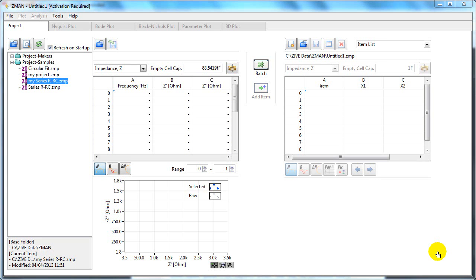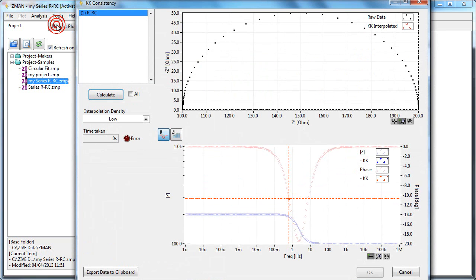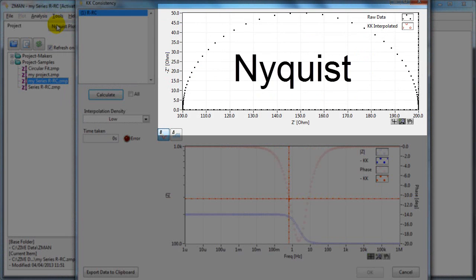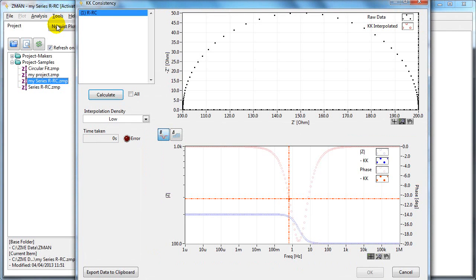This screencast shows how you can use the Kramers-Kronig Consistency to check the validity of your data. If you've opened up a project and have data in here, the analysis menu becomes live and you can click on KK Consistency. The top plot shows the Nyquist plot, the bottom one is the Bode plot. At the moment they're just showing raw data.